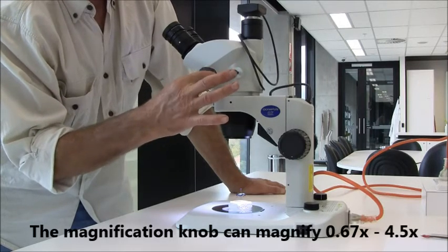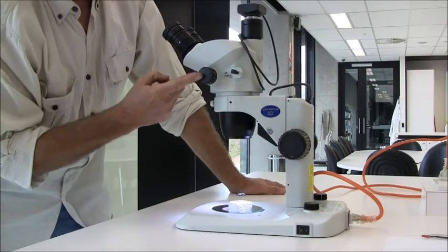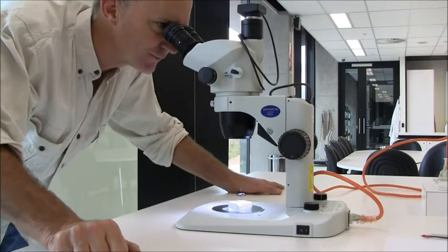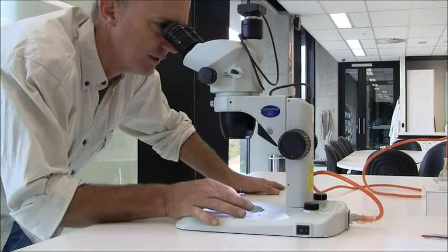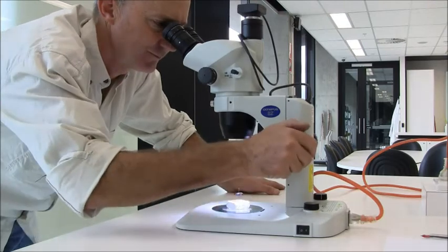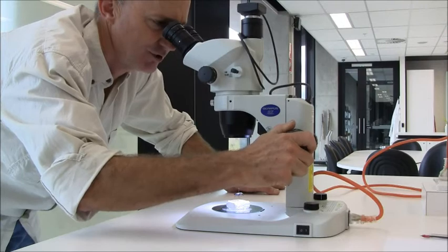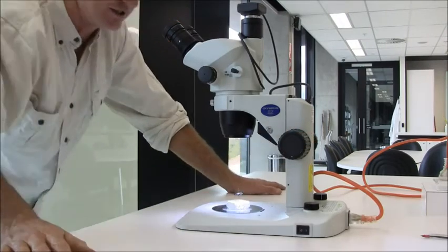All the way up to 4.5. So 10 times 4.5 is 45. Now I'm looking at this beetle at 45 times the magnification. I'll just readjust the focus. I can see the hairs on one of its legs, so we're getting quite a bit of detail.